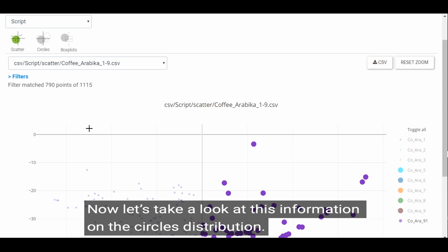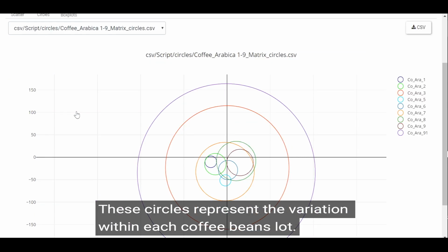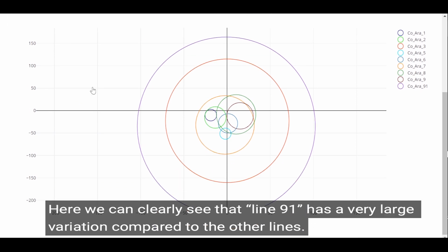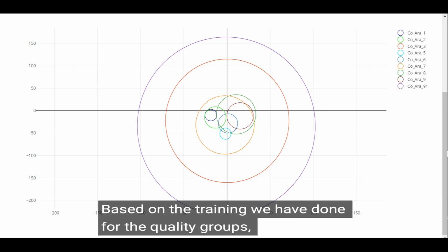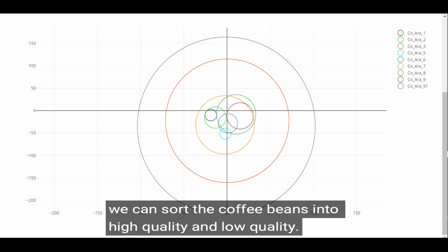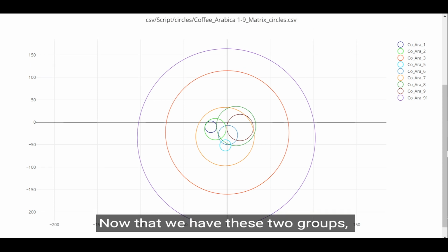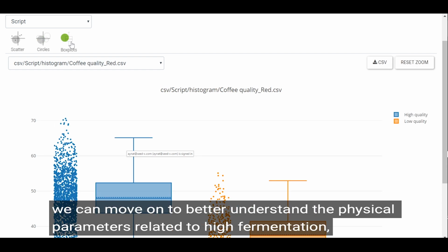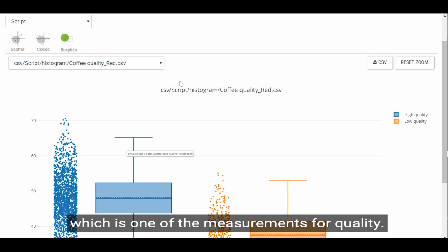Now let's take a look at this information on the circles distribution. These circles represent the variation within each coffee beans lot. Here we can clearly see that line 91 has a very large variation compared to the other lines. Based on the training we have done for the quality groups, we can sort the coffee beans into high quality and low quality. Now that we have these 2 groups, we can move on to better understand the physical parameters related to high fermentation, which is one of the measurements for quality.